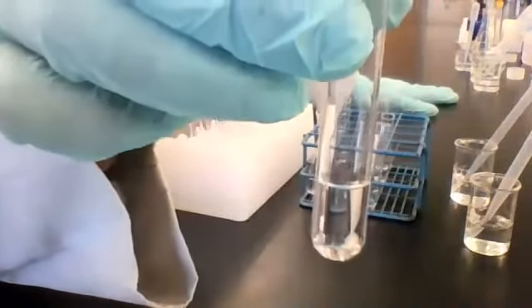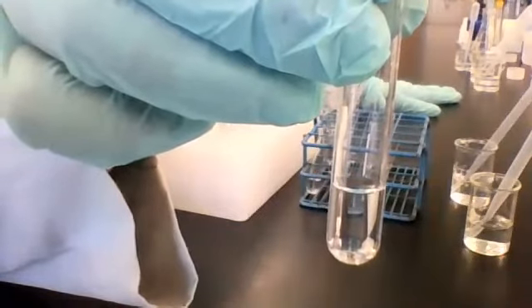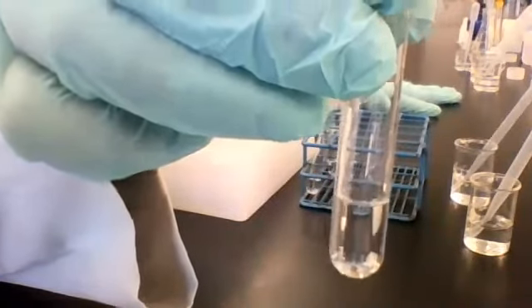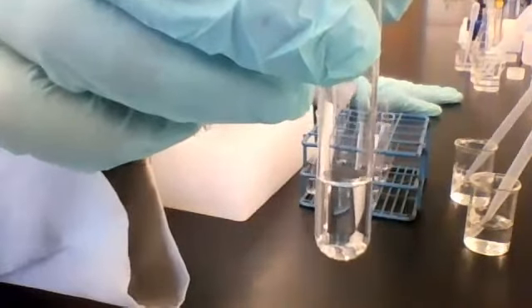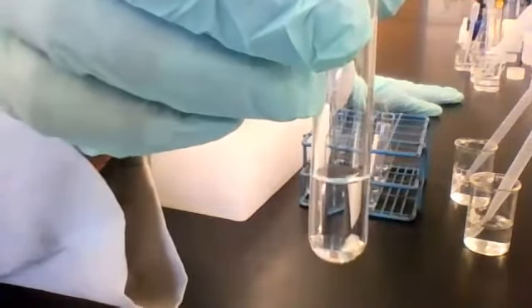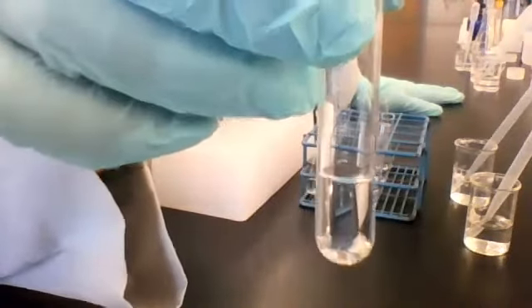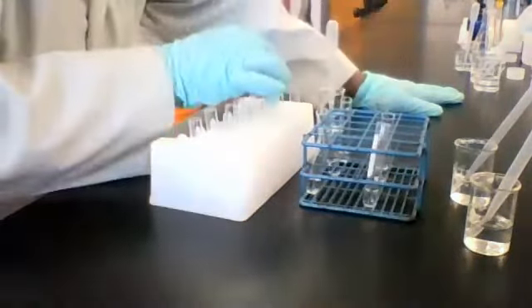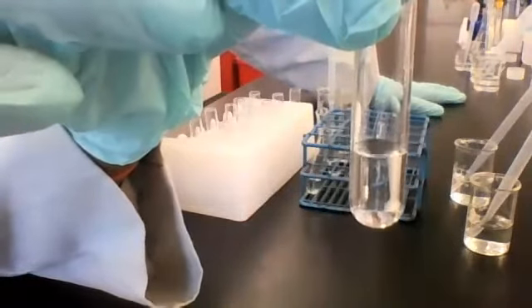All right, so this is solution 1 with reagent A. I'm not going to be writing it down, so look up and have a look at it and write down your observation. I'm not going to throw it away yet, so if you miss something and we have to go back, I'll pick it up again and show it to you again. Okay? So this is solution 1 with reagent A.